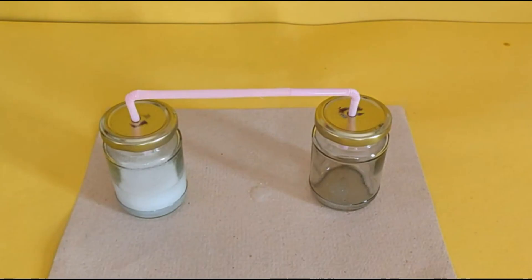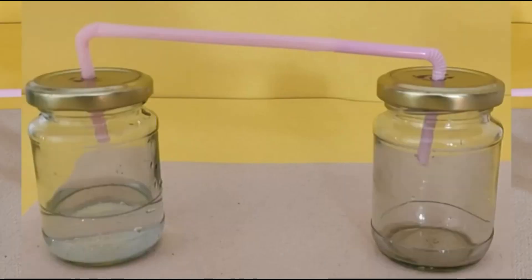What happened? Bubbles came out and that gas is collected in the second jar. Now, we have to test. Look here.